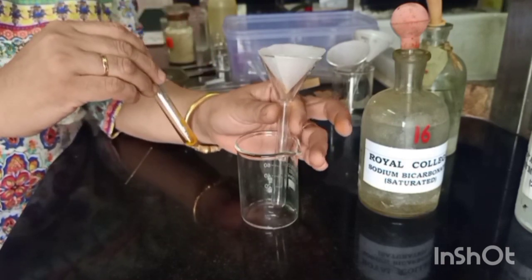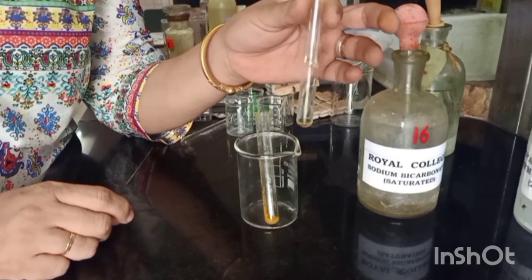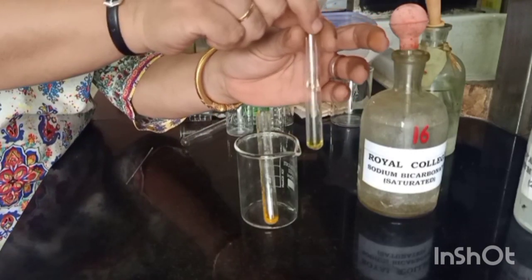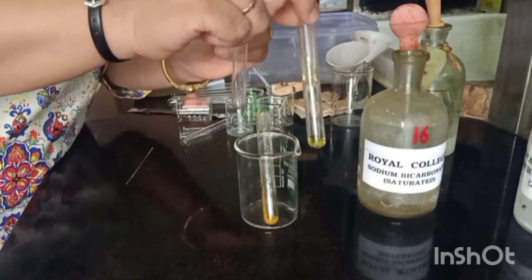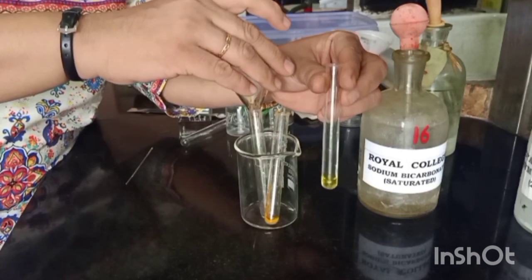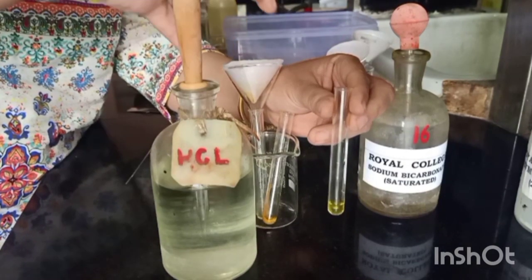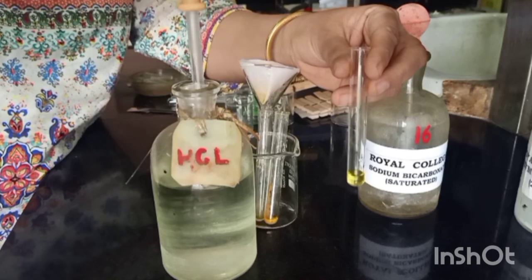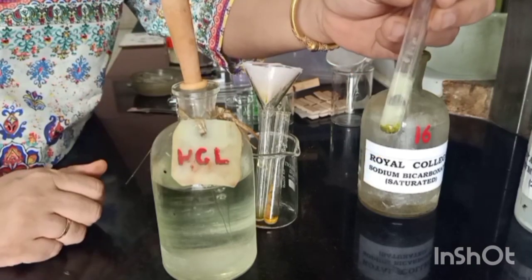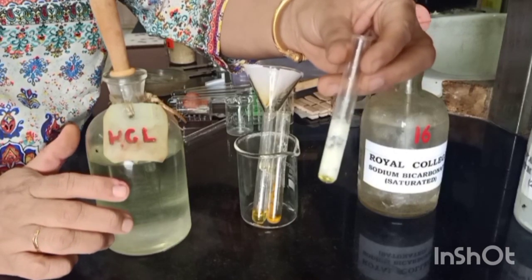We will check the filtrate for the presence of an acid by re-precipitation. Re-precipitation will be checked by the addition of concentrated HCl. Let's add concentrated HCl to this drop by drop. As you can see, we have got a distinct white solid indicating the presence of a water-insoluble acid.